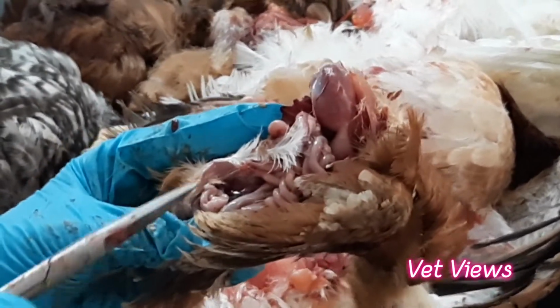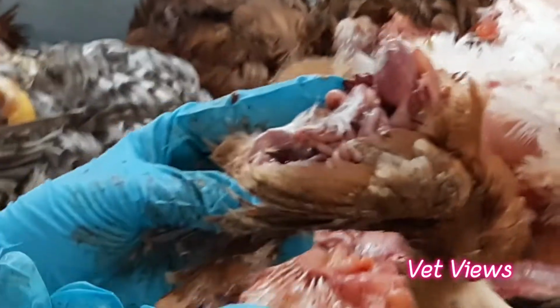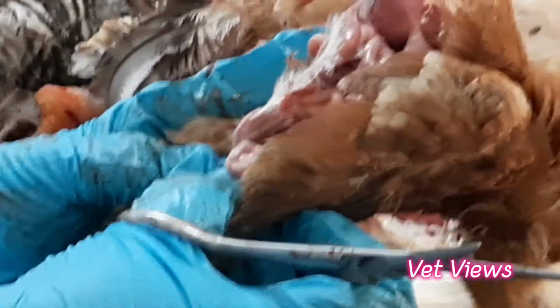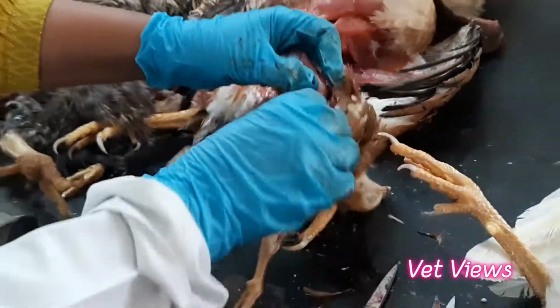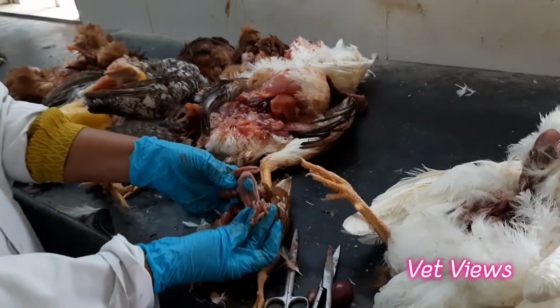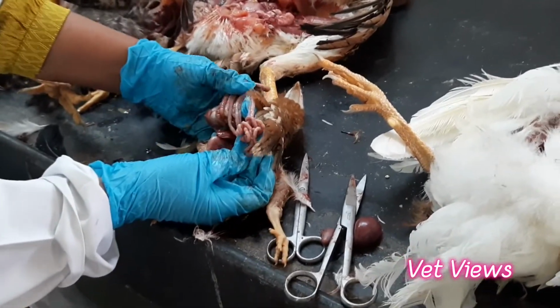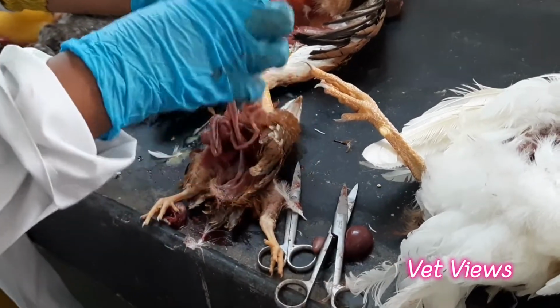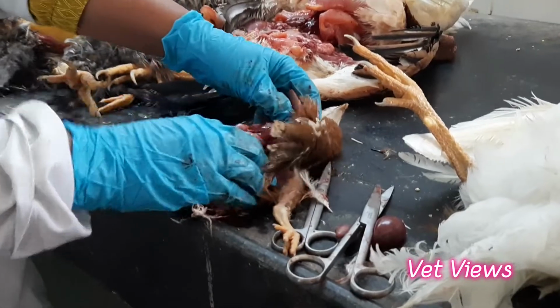So in bursal disease, there will be edema, there will be severe hemorrhage, and the size itself will become double or triple. That you can easily find out. This is a bursa. See, if you see this intestine, they are all shrunken. You can make it out now. So severe dehydration has happened, and the bird has not taken any feed. That's why the intestines are not filled up. See, it's all very shrunken and there is no contents. The bird has not taken the feed.